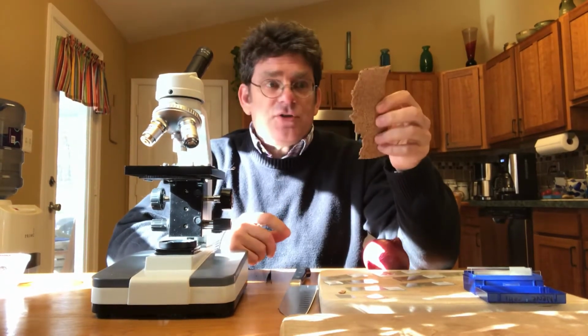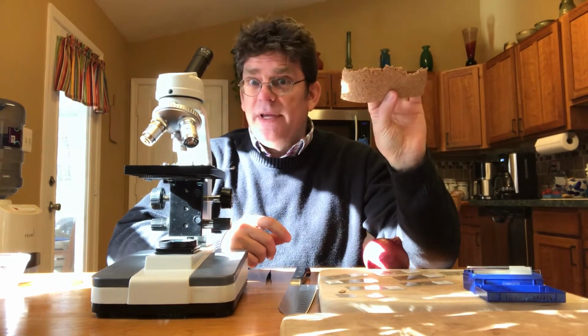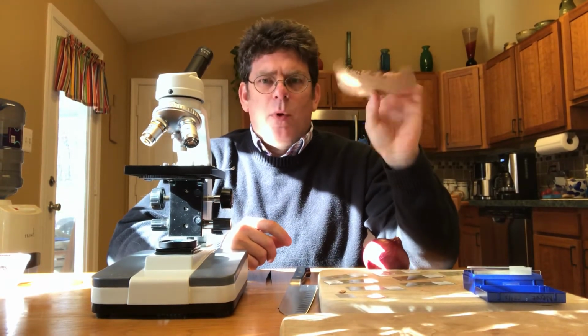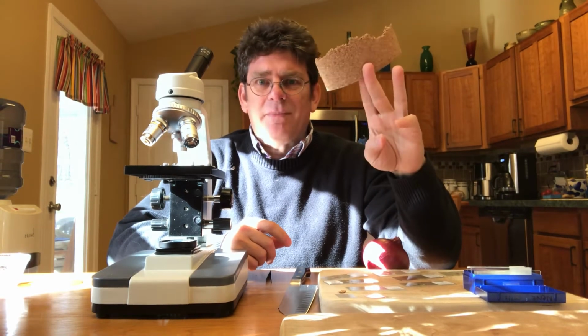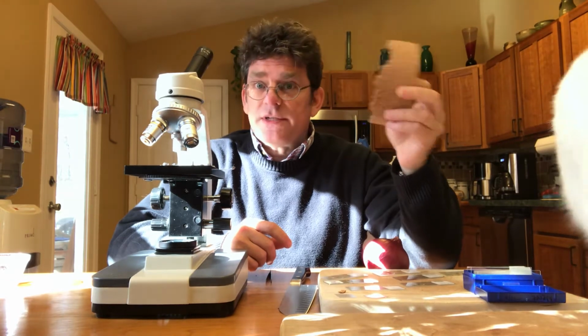And cork comes from the inside of a tree. So what do you think? Cells or no cells? Yeah, it's from a tree, so you're definitely going to see cells. Now, what part of the cell are we going to see? I mean, is there going to be living parts inside of this? No. What we're going to see left over in a piece of cork is the cell wall.